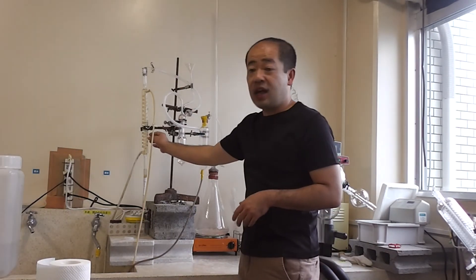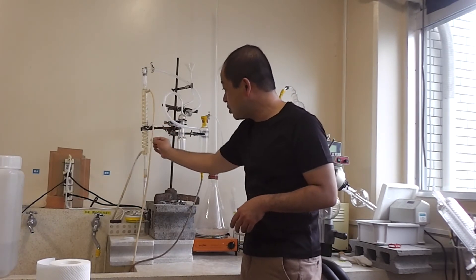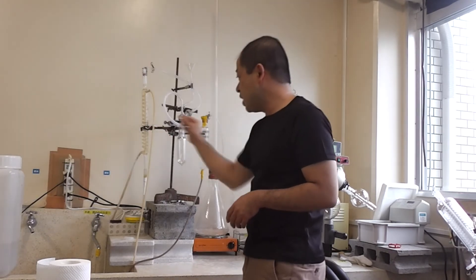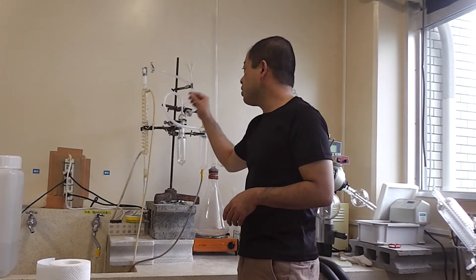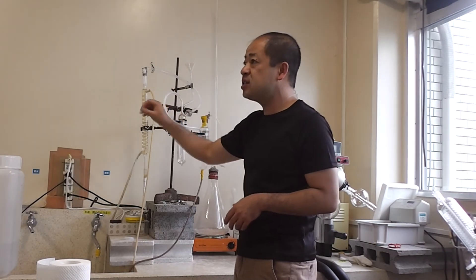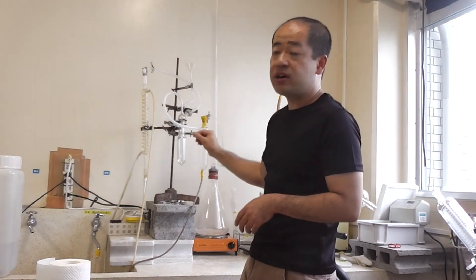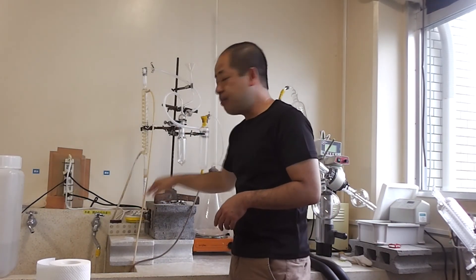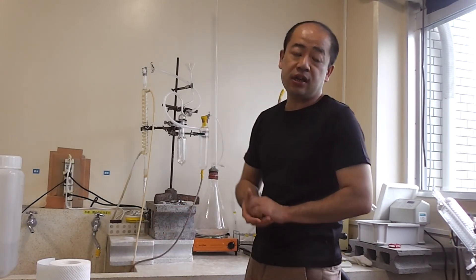So in that case, how can we collect the ammonia gas? Here you can see some spiral tube. So we try to put some cold water. By cooling, the ammonia gas changes again to liquid — so many waters. So as a liquid form, we can collect the sample again, and by determining the ammonia, we can estimate protein concentration.